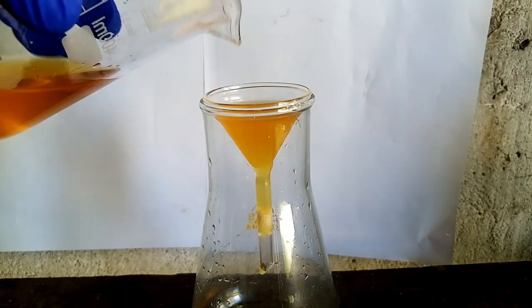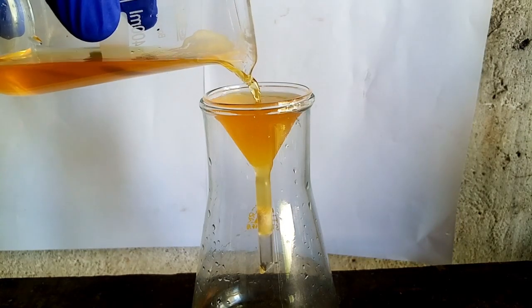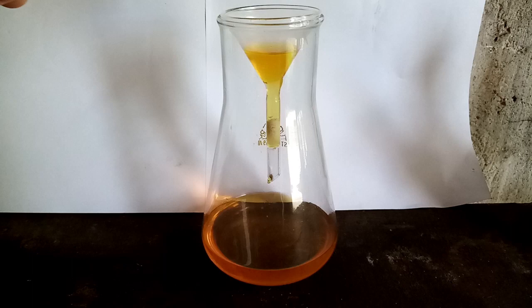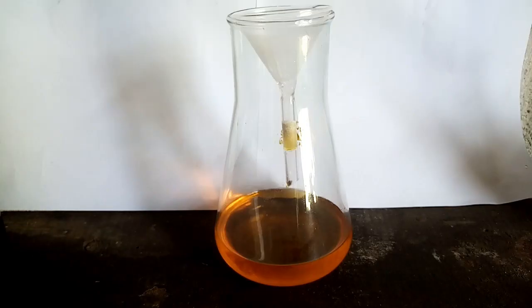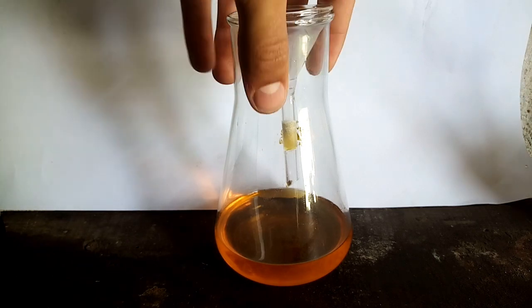After I filtered most of the acid from the beakers, I was left with beautiful nitric acid. The color is because of the dye from the sulfuric acid drain cleaner that I used. To store the acid, I'll use a brown bottle.